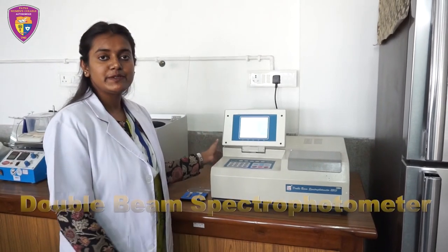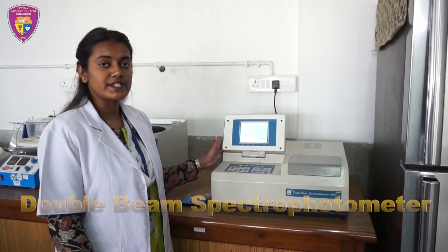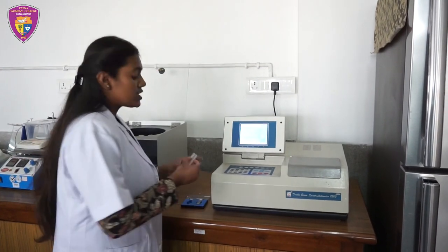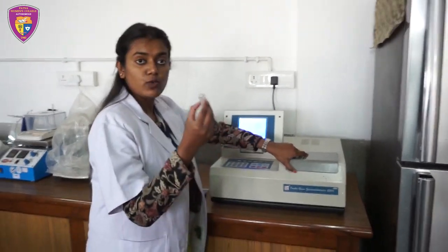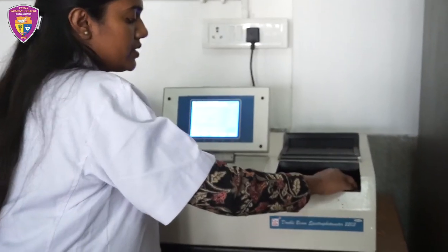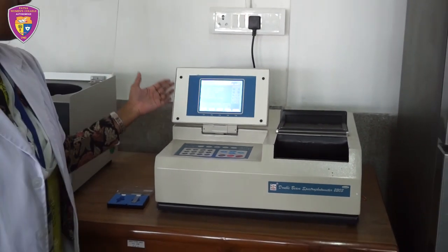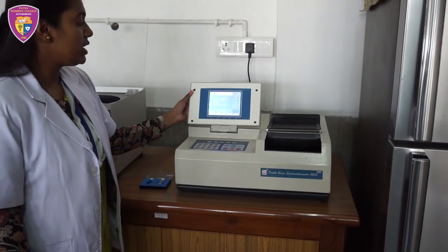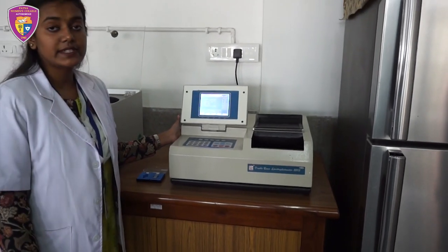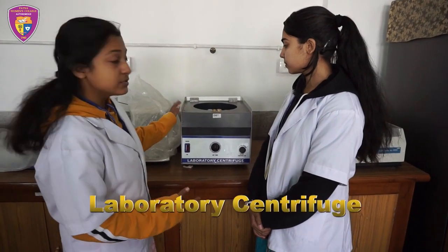This is a double beam spectrophotometer. It is used for measuring the absorbance of light of a specific solution. The solutions are placed in a quartz cuvette and the cuvette is placed in the sample chamber. We can measure the absorbance and concentration of a solution at a single wavelength as well as multi-wavelength.